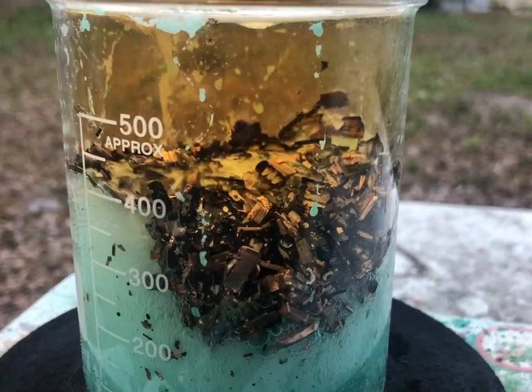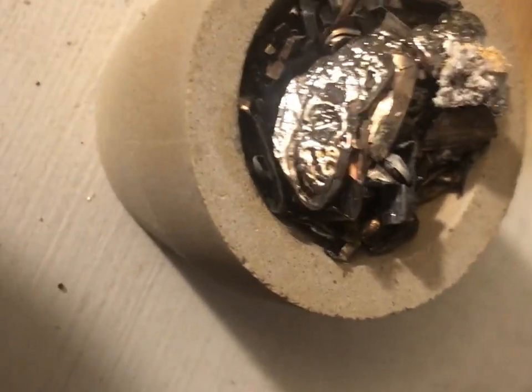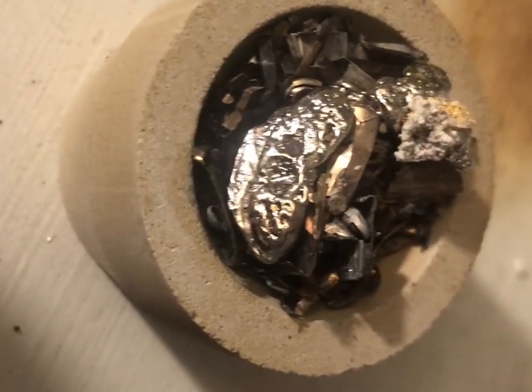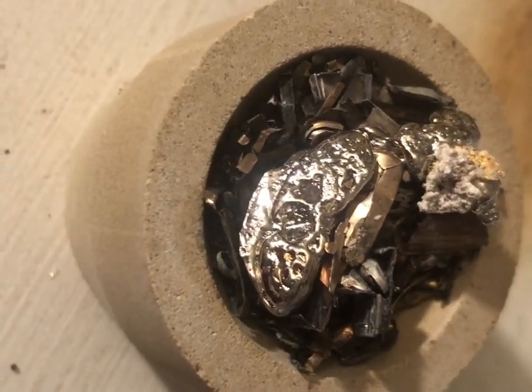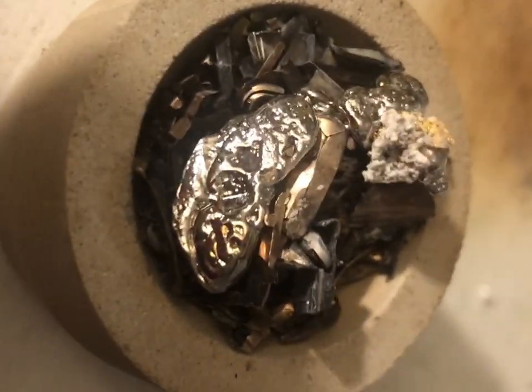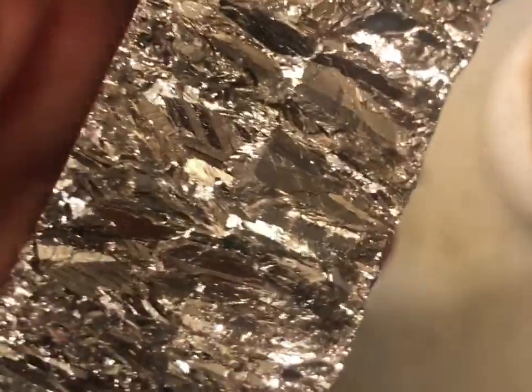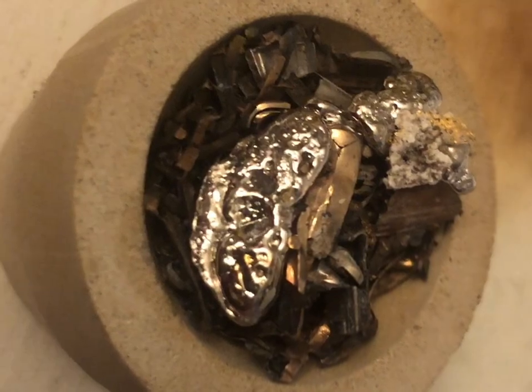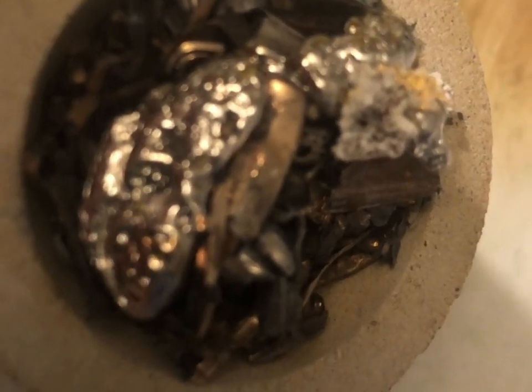You can see how light and fluffy the gold foils are now floating on top. I'm completely changing my plans — a viewer asked about putting gold-filled material in a crucible. This was already treated with dilute nitric acid to get rid of the base metals and then incinerated. That silver material on top is bismuth, which is apparently less toxic and a bit more pure than using lead. I'm going to put it in my furnace, heat it up, and we're going to see what happens.